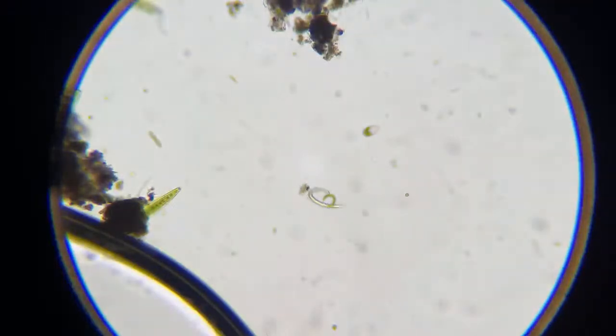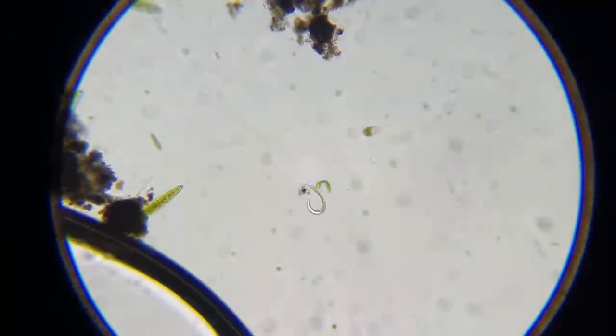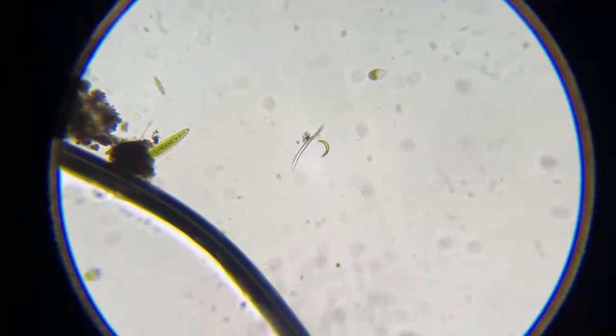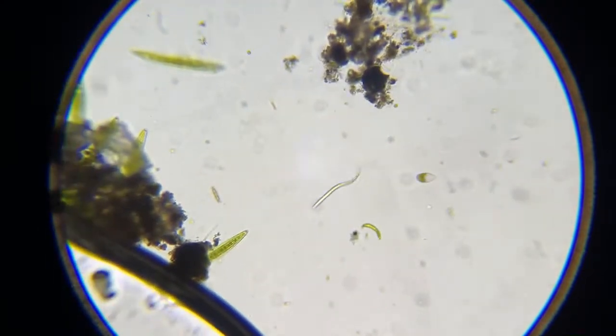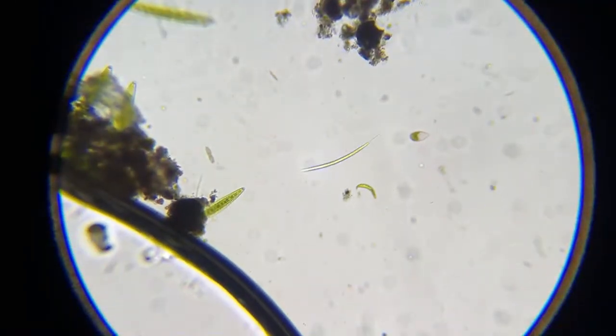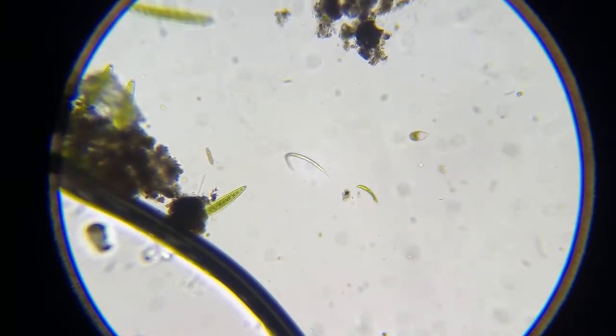Well, he's dangerous to your dogs if your dogs don't have shots and stuff. But humans could get infested with hookworms. I don't want to say it's rare, but it would be rare in industrialized countries. But you can get them. I mean, they usually will enter through your feet and hands. I think their larvae will burrow into your feet and hands.